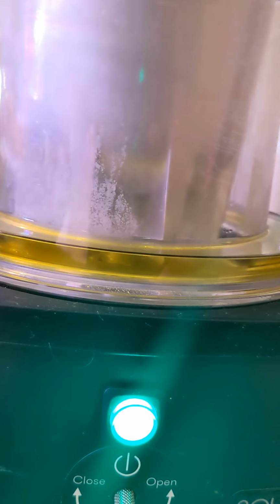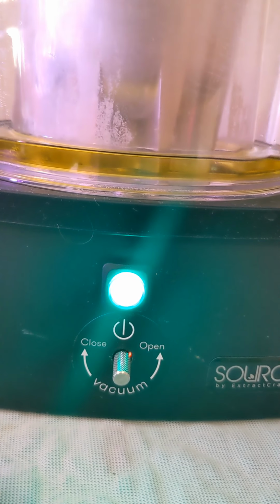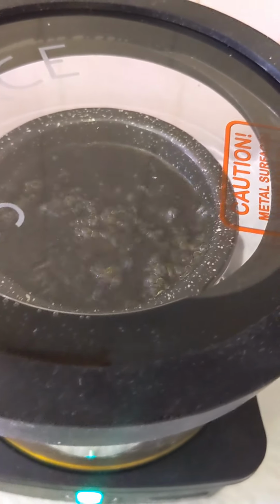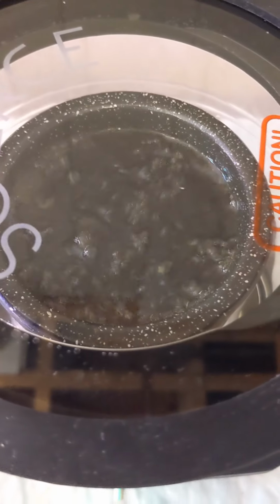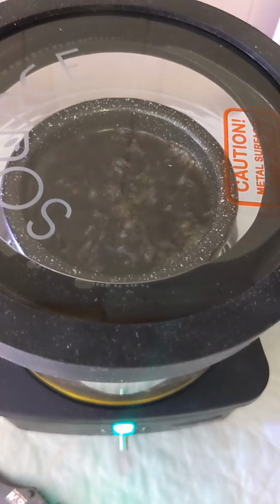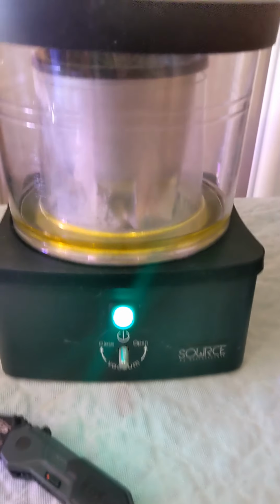It leaves a bit of chlorophyll or something in there, but the essential oils will remain in the crucible, and you'll be left with an oil which you can continue to leave under vacuum and mild heat. It's only a mild heat, even though it looks almost feverishly boiling there. The vacuum is helping to create that boil. It's under the temperature, I believe, that alcohol would normally boil at without a vacuum. So you can reclaim that alcohol and use it again next time for the next extract, which is pretty sweet.